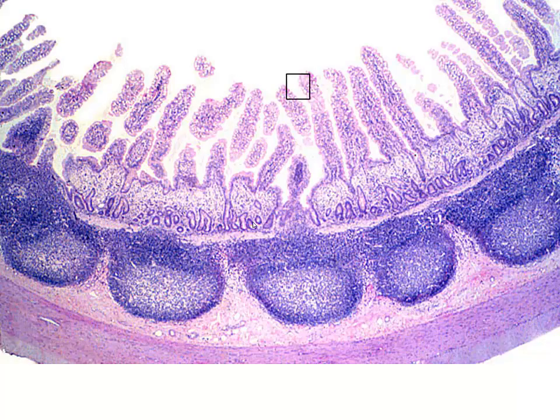Now, these secondary lymphoid nodules, we can describe them exactly how we could describe them in a lymph node, for instance. We have the germinal centers, we have the outer coronal material. So these are secondary lymphoid nodules. Again, as we've mentioned before, these are permanent structures that are present in the ileal submucosa and extending up into the lamina propria.